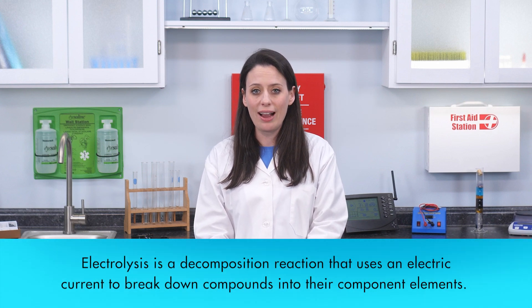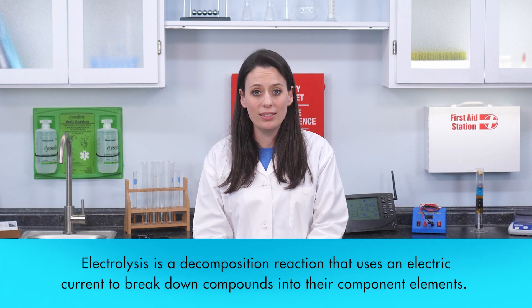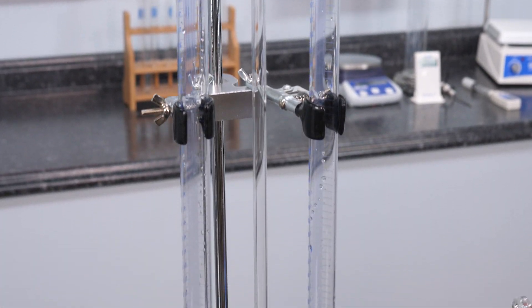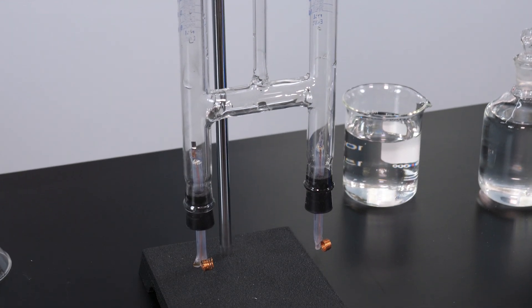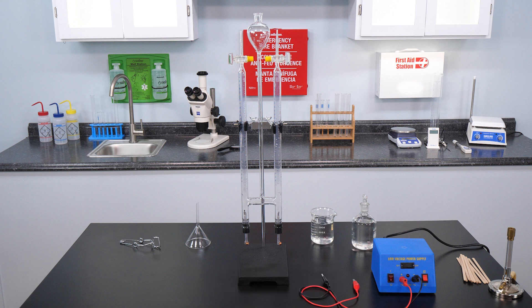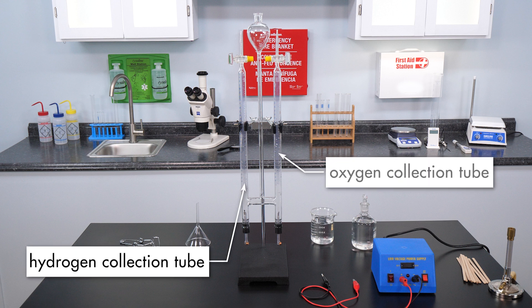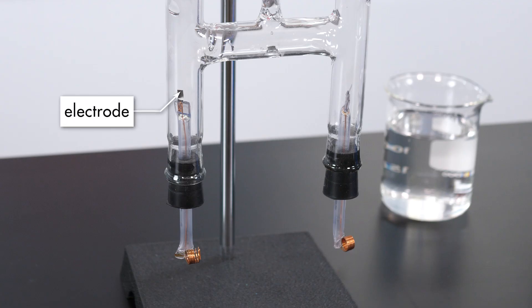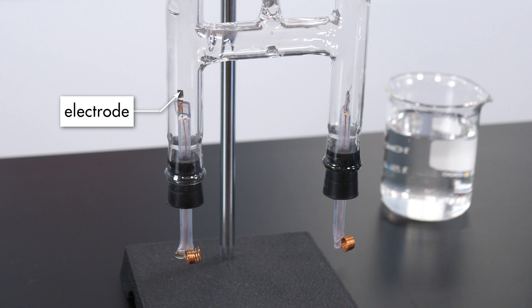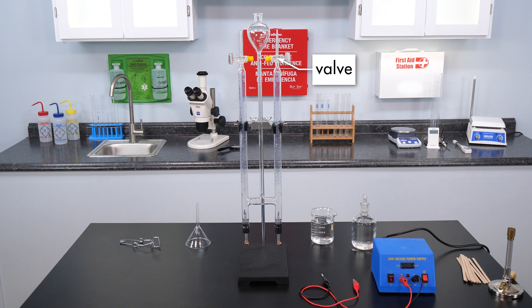Electrolysis is a decomposition reaction that uses an electric current to break down compounds into their component elements. A convenient way to decompose water is to use a Hoffman apparatus like this one. The Hoffman apparatus consists of three glass tubes that are connected near the bottom. The tube on your left is the hydrogen collection tube. The tube on your right is the oxygen collection tube. A platinum electrode is inserted in the bottom of each of the gas collection tubes. The electrodes will be connected to an electric power supply with cables. The valves at the top of each collection tube allow us to release some of the collected gases.